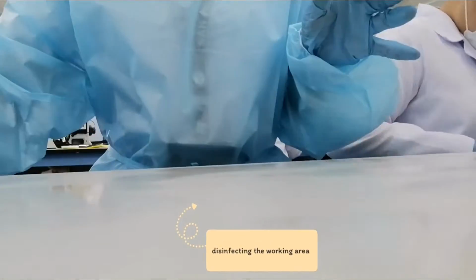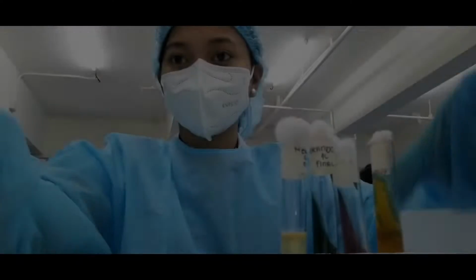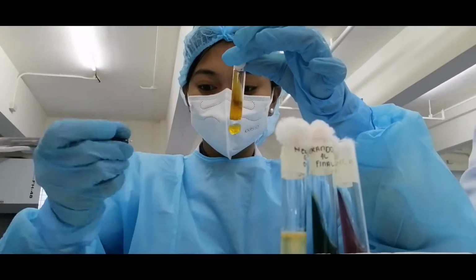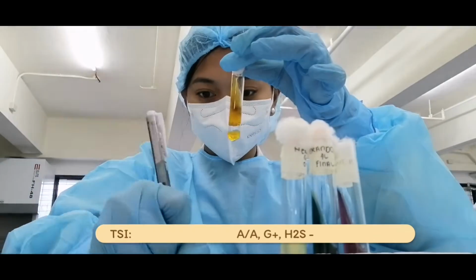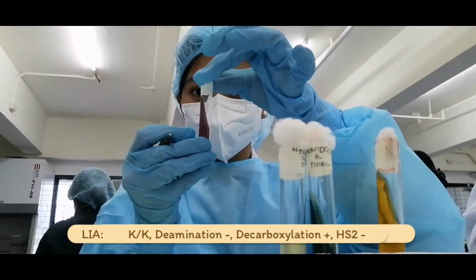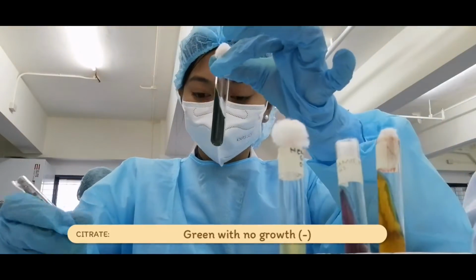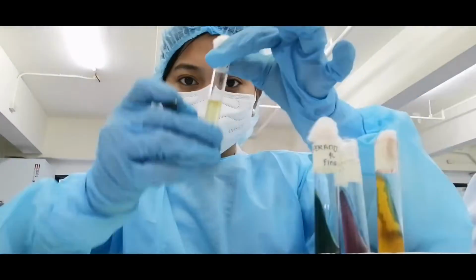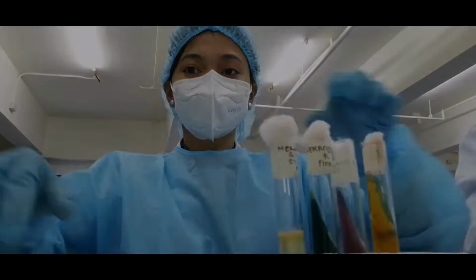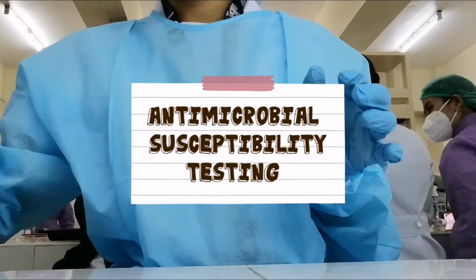The first thing we should do after donning the PPE is to disinfect the working area. This part is a continuation of our first cycle videos, the reading of results in biochemical tests. Antimicrobial susceptibility testing.